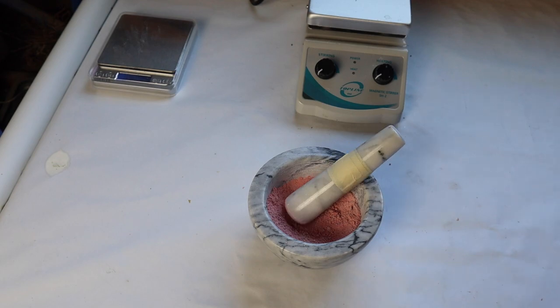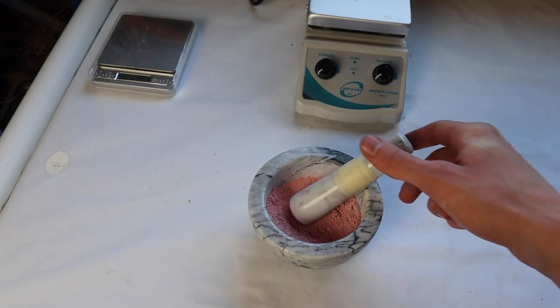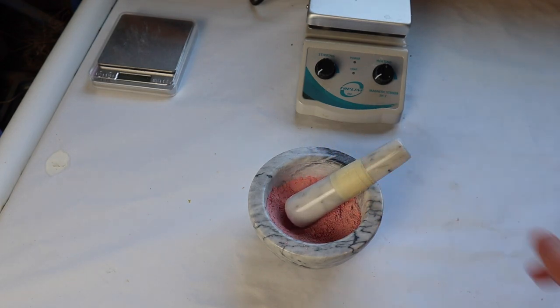Most of the stuff can just be burned right off. I'm taking heavy inspiration in this video from NileRed and NerdRage. What I'm going to do now is transfer this to the burner and try and burn off everything that's not calcium carbonate.